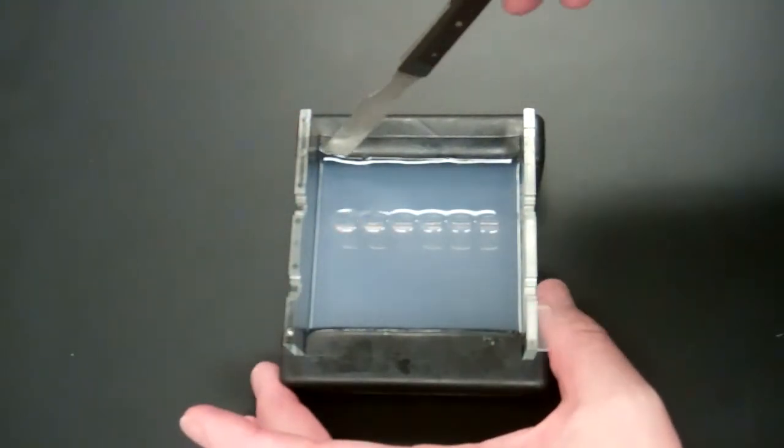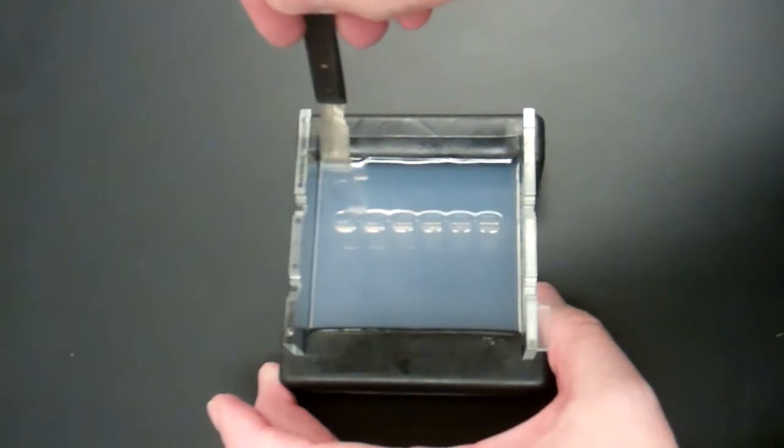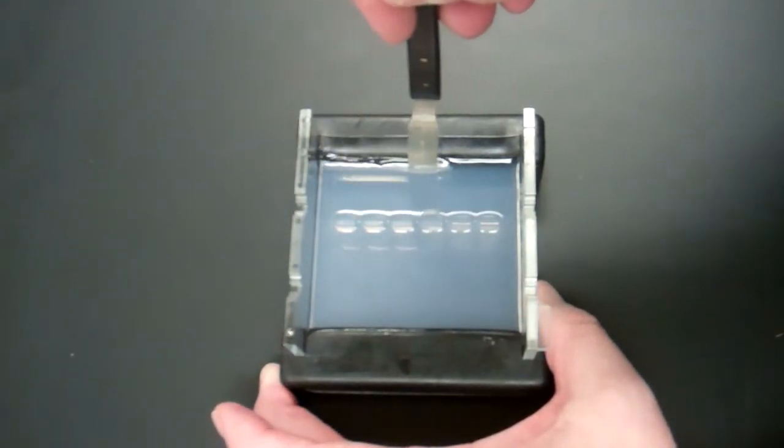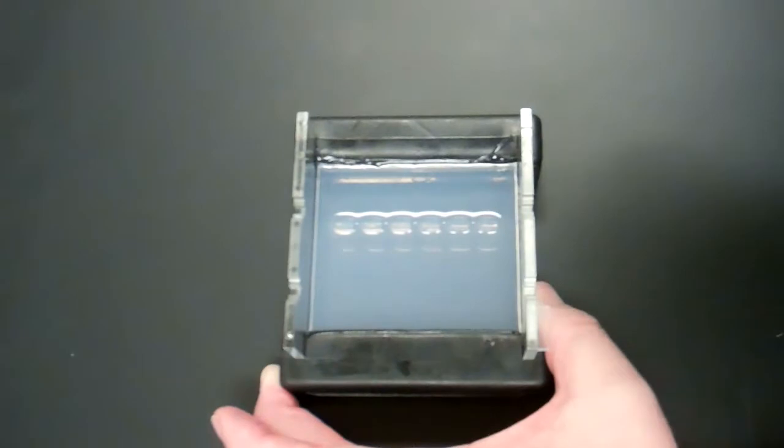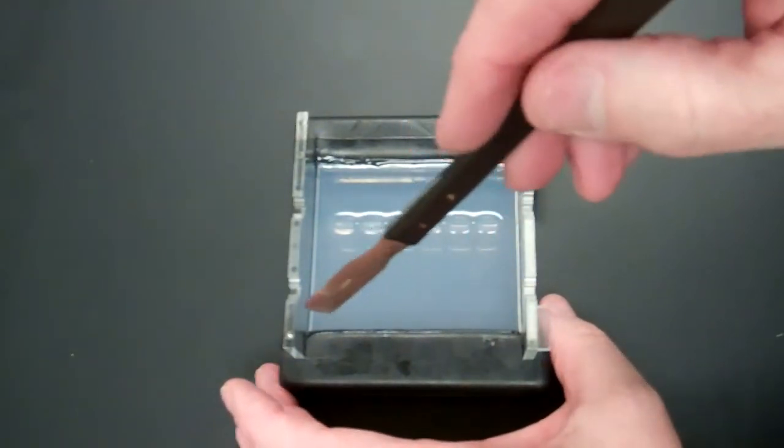Next we have a little spatula tool that you can just run right up against that rubber bumper. And now we want to do the same thing here.